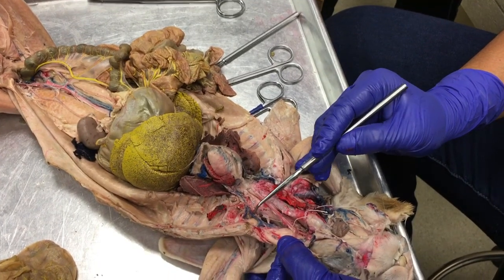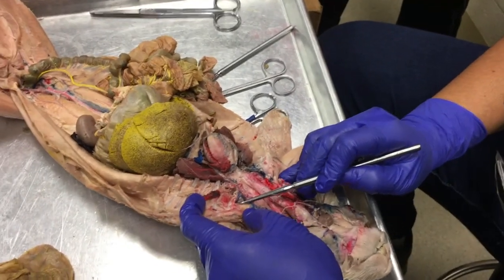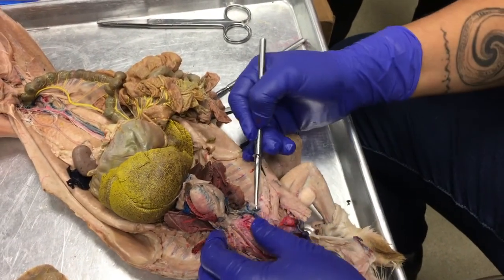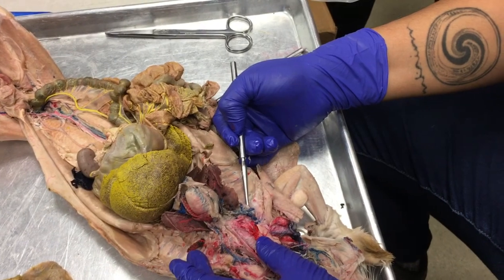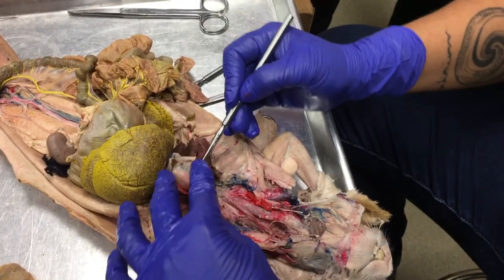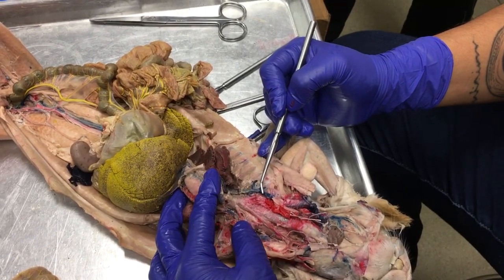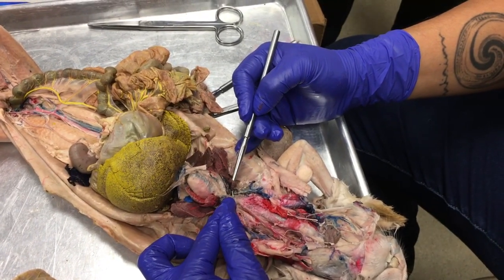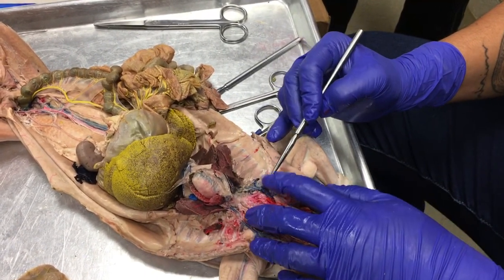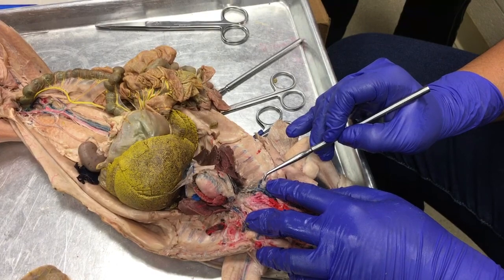Okay, so internal jugular vein joins in here with the external jugular, and then coming from the arm we have this big branch here. This is our subclavian vein. Okay, left subclavian, right subclavian, joining in with the subclavian vein and the external jugular. When those two join together, the big branch leading to the right atrium is called the brachiocephalic vein, left and right. Joining in with the brachiocephalic vein is this vein coming from the outside chest wall. This is the internal mammary vein.